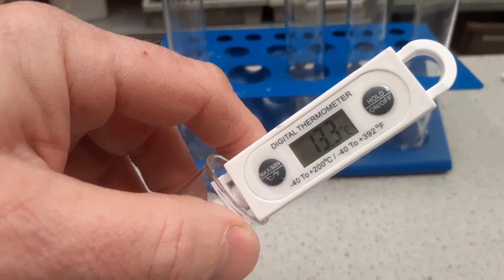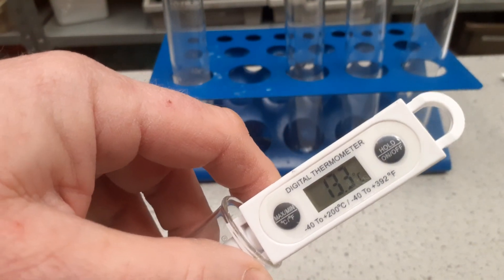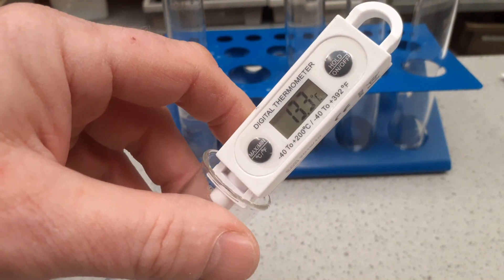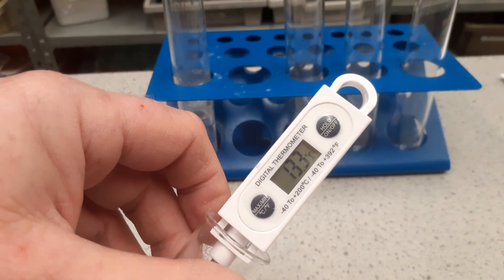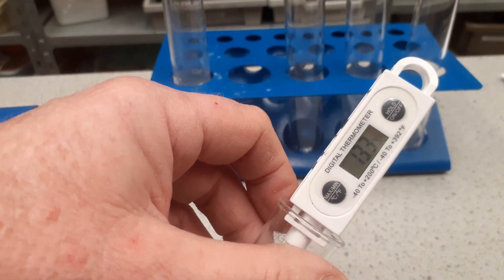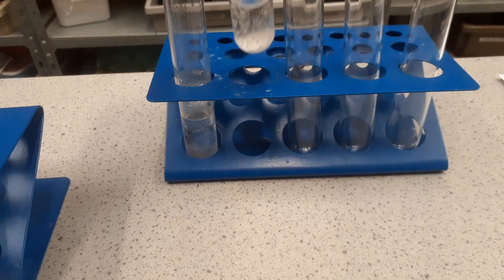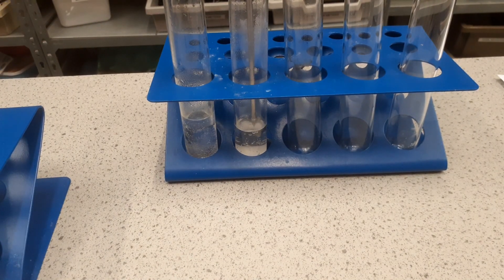Now here we can see this one - the temperature actually drops. It's gone down, as you can see, to 13.3 degrees C. So a different type of reaction. We'll talk about that later in our discussion.